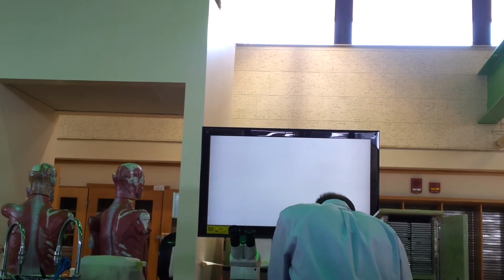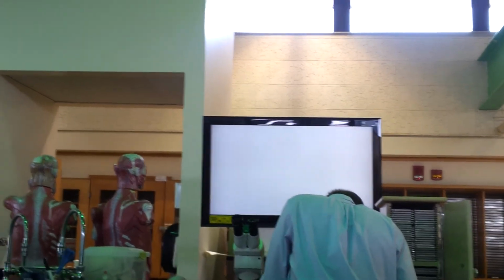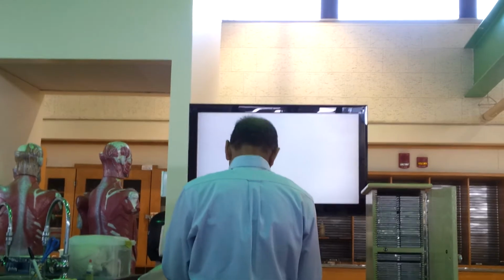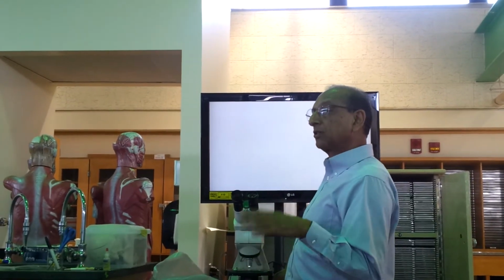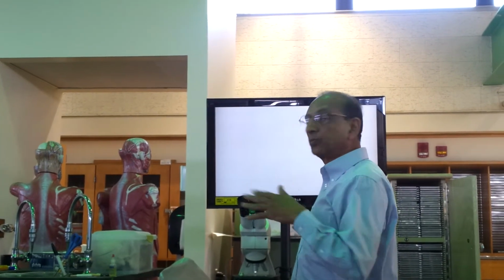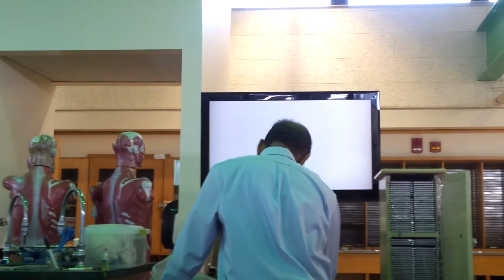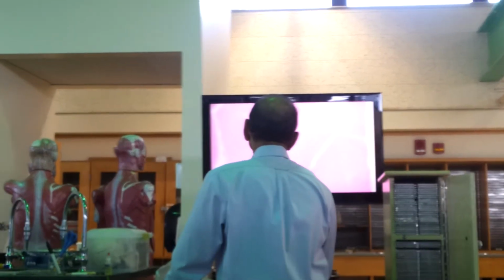Liver. How many slides are there? Ten. Liver slides, some show a good picture, others do not. So again today, make sure that you look at different slides. All of you will pull out a microscope and look at this slide. They're going to be different. So from what I'm showing you here, the exam will be bad. You know I'm not good at slides, right?